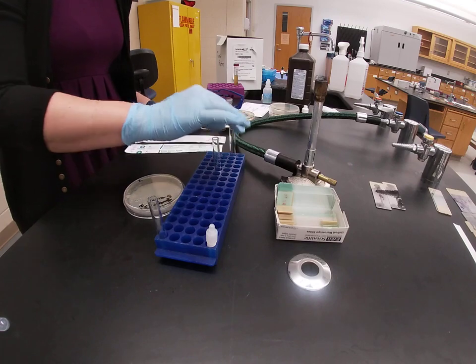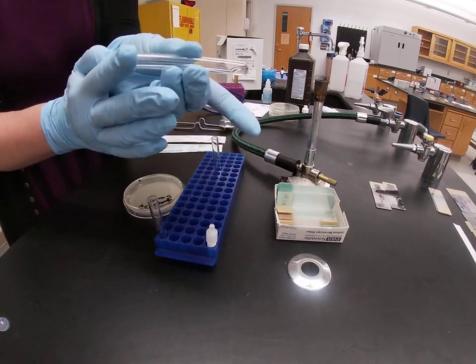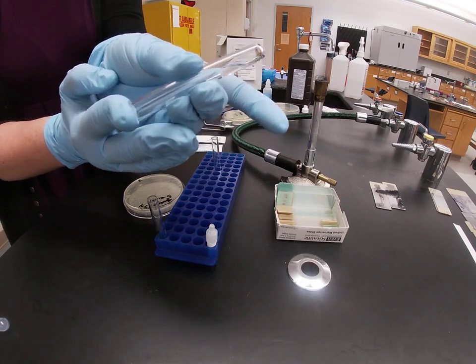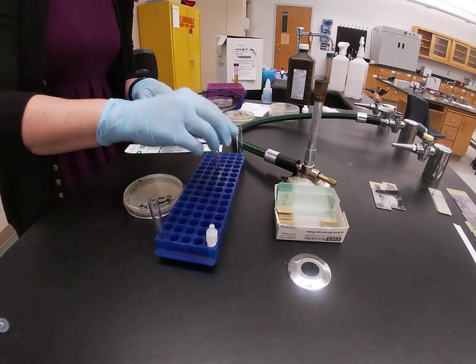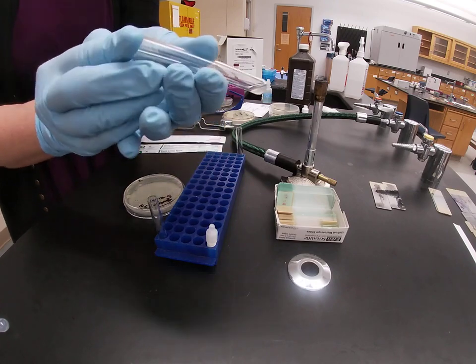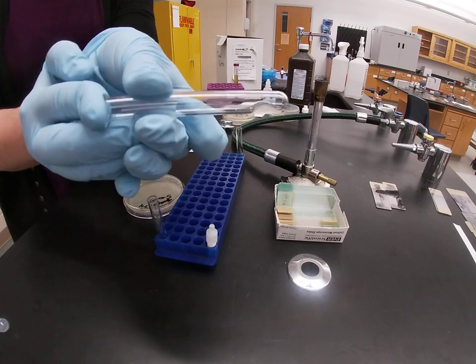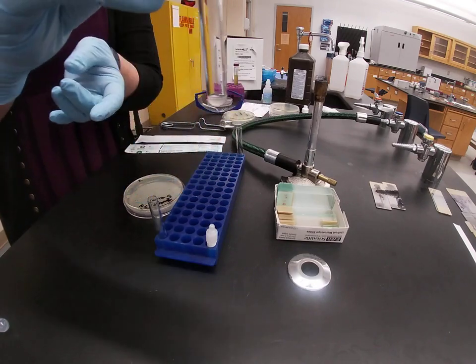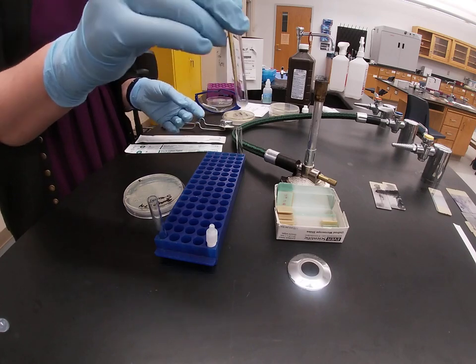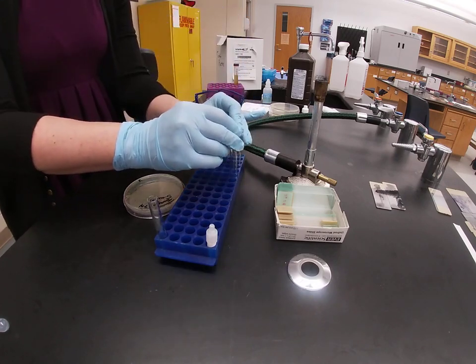An organism that is coagulase negative, your test tube will look the same. Your reagent will still be completely and totally liquid. Whereas organisms that are coagulase positive will form a clot. You'll see they form like a jelly-like clump in the bottom of the tube. Sometimes it's even so solid that it completely sticks to the tube. So coagulase positive forms the clump, coagulase negative is still completely liquid.